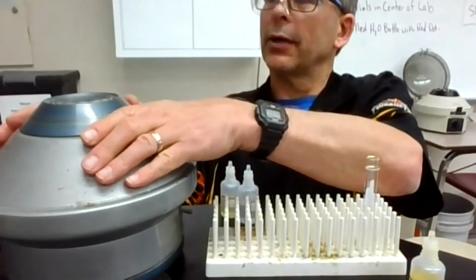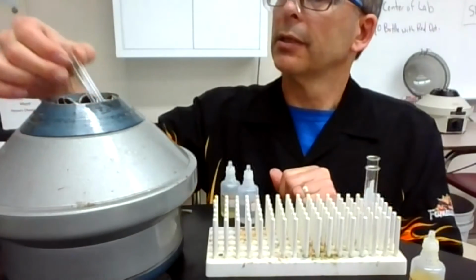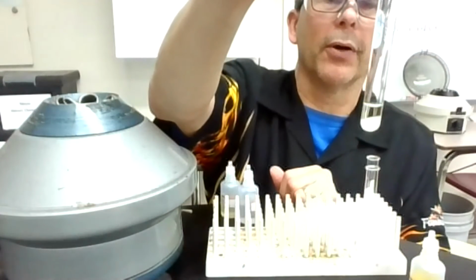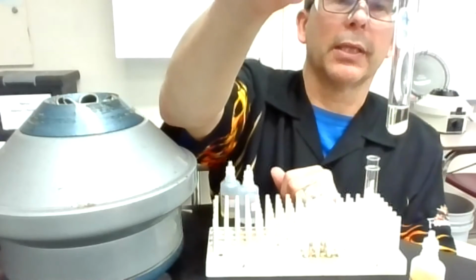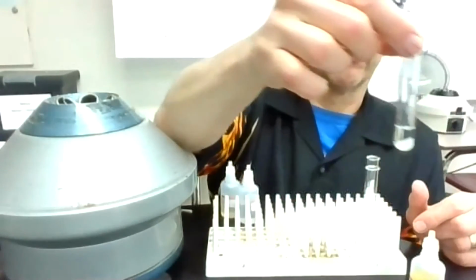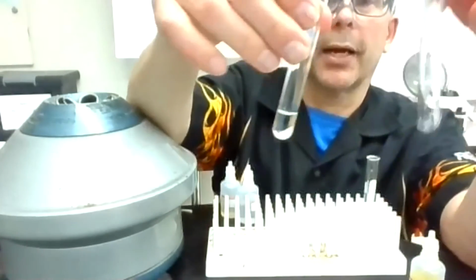So I'm going to let it slow down. I'm going to grab the test tube. Oh, that looks great. So that really separated out. You've got this white precipitate, it almost looks kind of fluffy. Like, do they still make Three Musketeers? It almost looks like the inside of a Three Musketeers bar. But I'm not going to taste it to check that out.